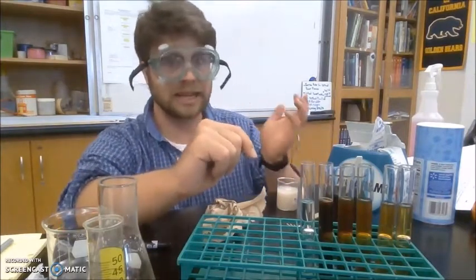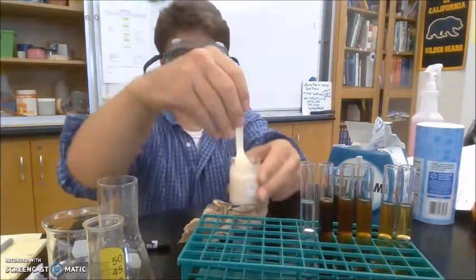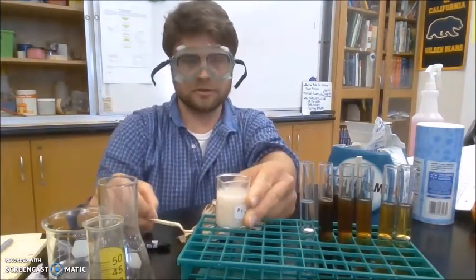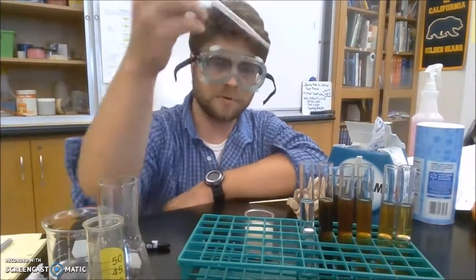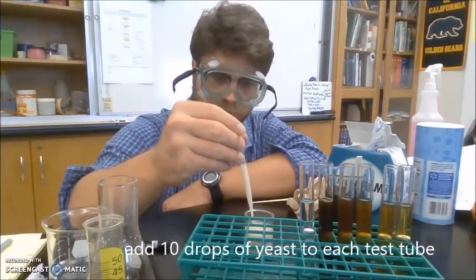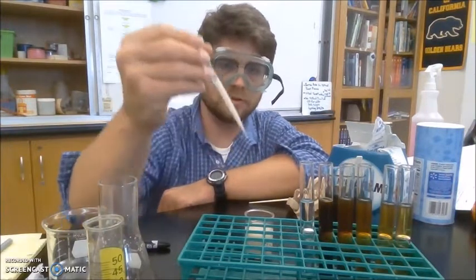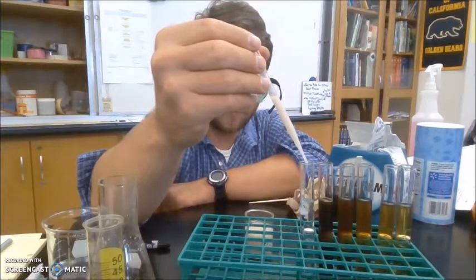So now I need to add the yeast. So I want to mix up the yeast solution. So I have it here. Give it a good mix. I'm using a plastic fork. You can use anything really to mix it up with. I have a plastic pipette dropper, so I'm going to pull out a pipette full. And I want to add 10 drops to each test tube. So 1, 2, 3, 4, 5, 6, 7, 8, 9, 10.